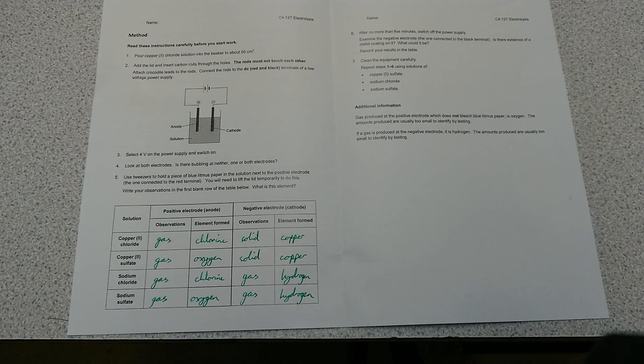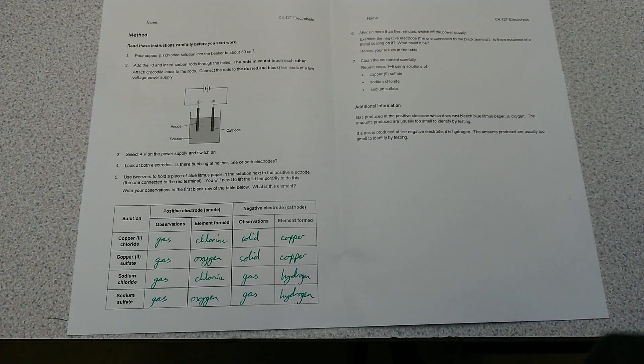So there you have it. We've seen what happens when we run electricity through those aqueous solutions. Remember, aqueous means dissolved in water.